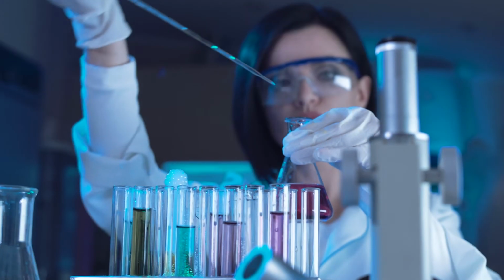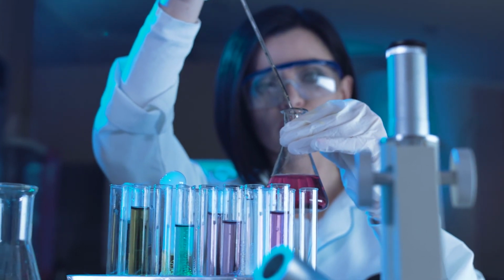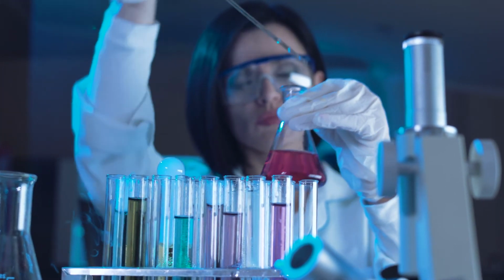The raw amount calculated above may be corrected for dilution of the sample and for variations in injection volume and sample weight. The corrected amount is then assigned to the peak. This is the number that appears in all reports.